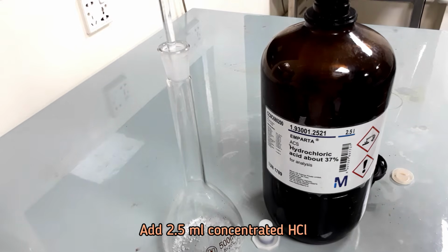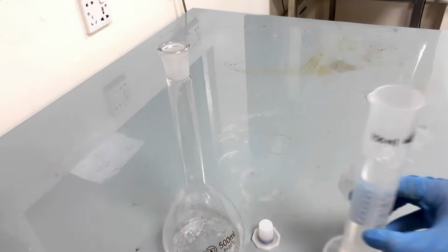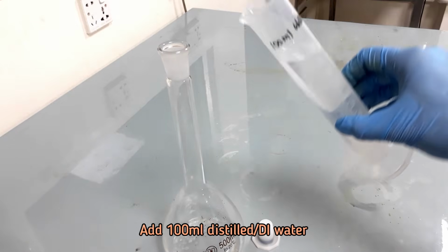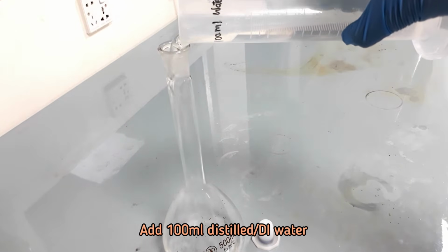Add 2.5 ml concentrated hydrochloric acid. Add 100 ml distilled water and swirl the flask to dissolve the sucrose completely.